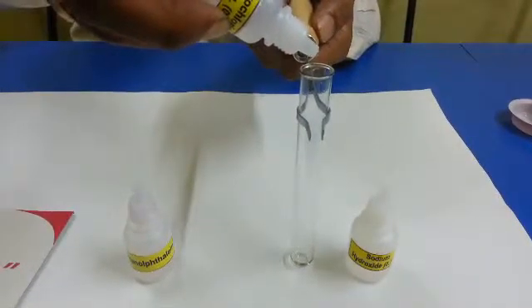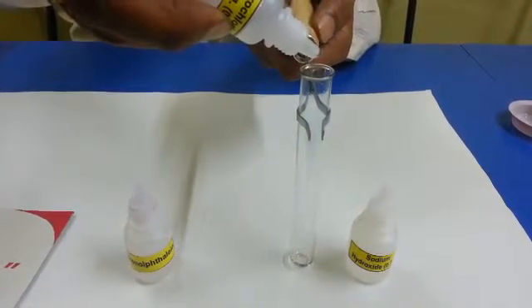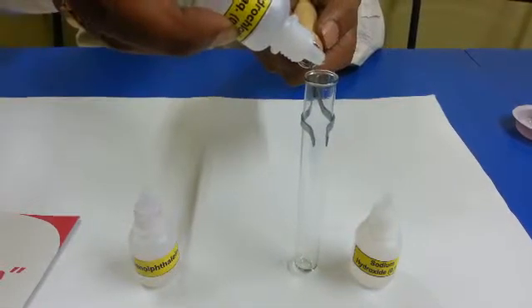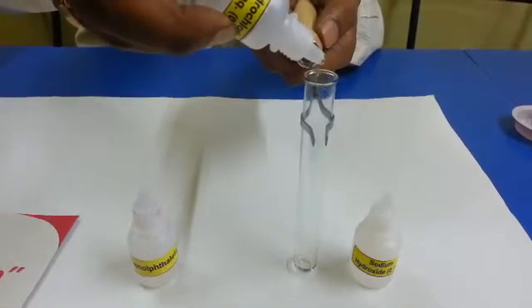Setup for reactivity of HCl with NaOH, termed as neutralization reaction. Put two drops of hydrochloric acid in test tube.